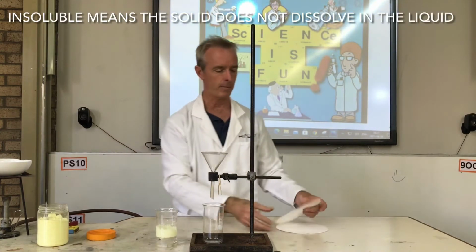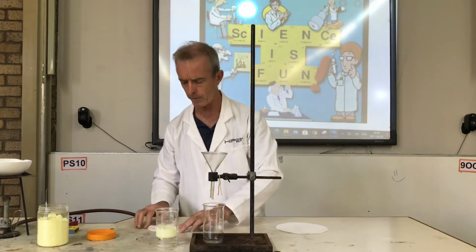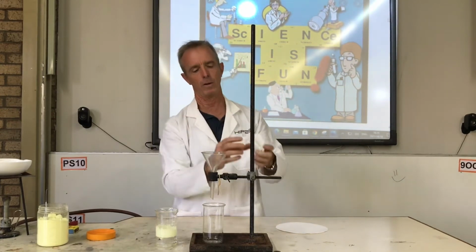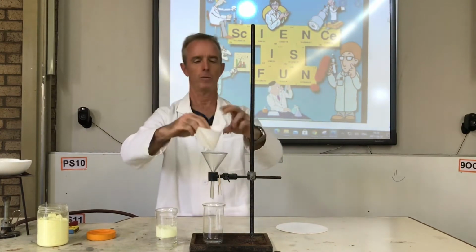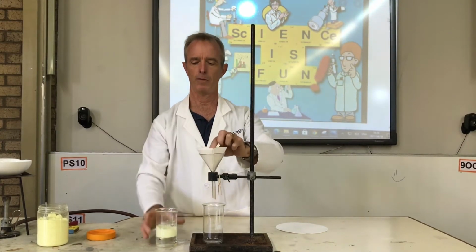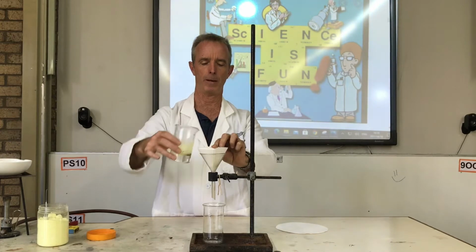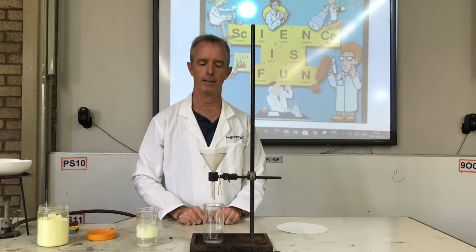So now, if you take a piece of filter paper and you fold it in half, and you fold it in half again, then you will see that it's got 4 pieces to it, and if you open up one side and you put that in, then what you've got is a funnel, and if you pour the liquid through, the water is going to go through the paper and the sulfur is going to stay behind.